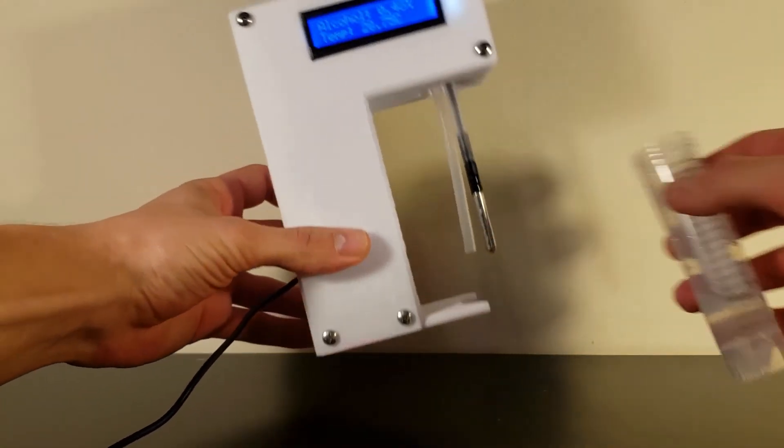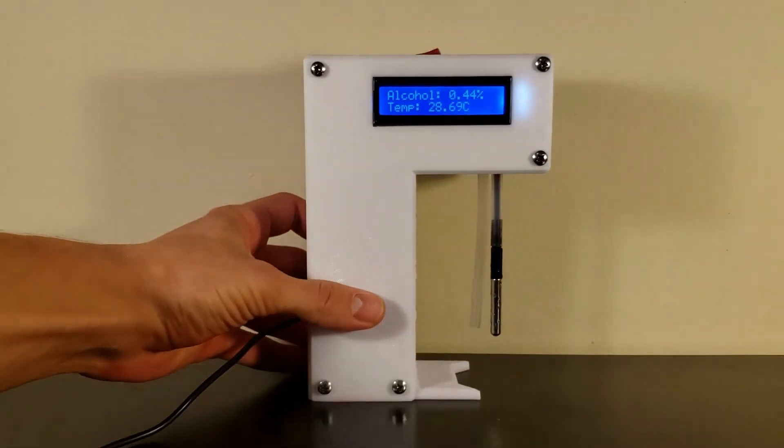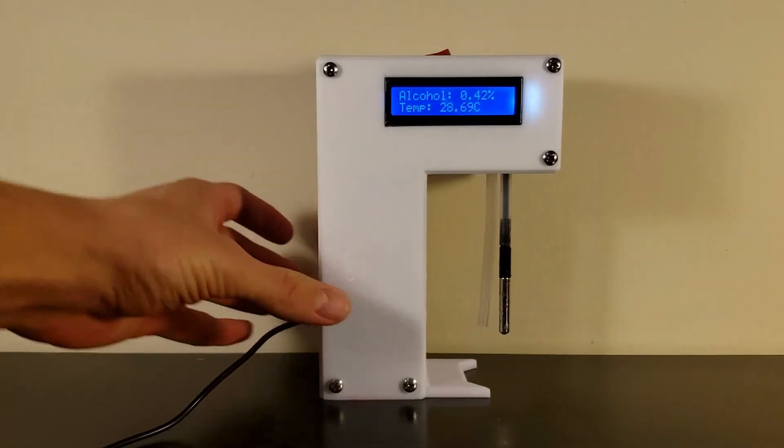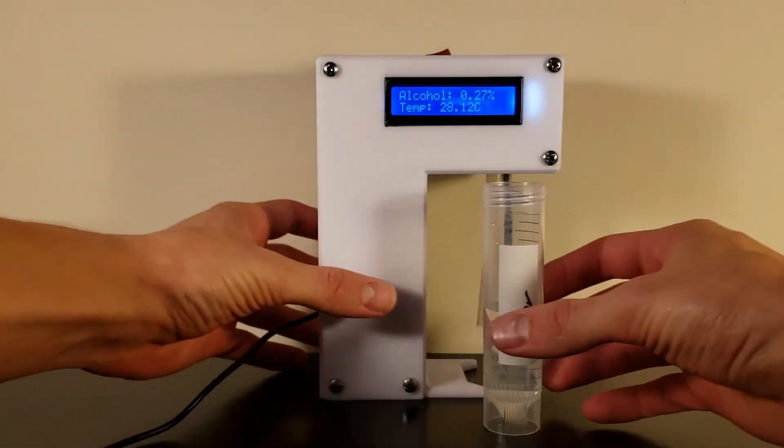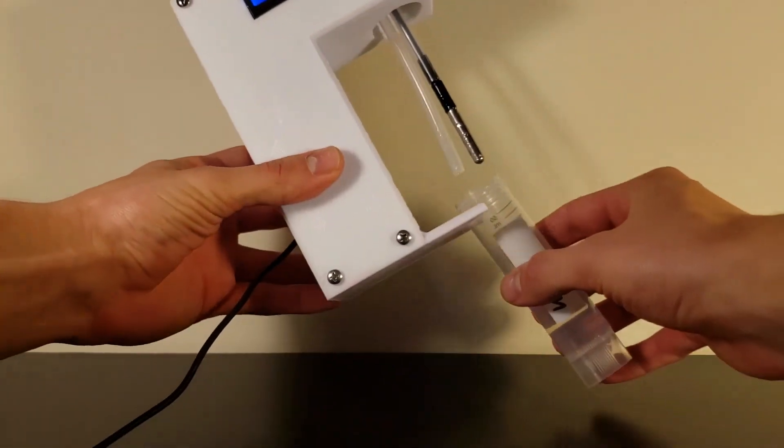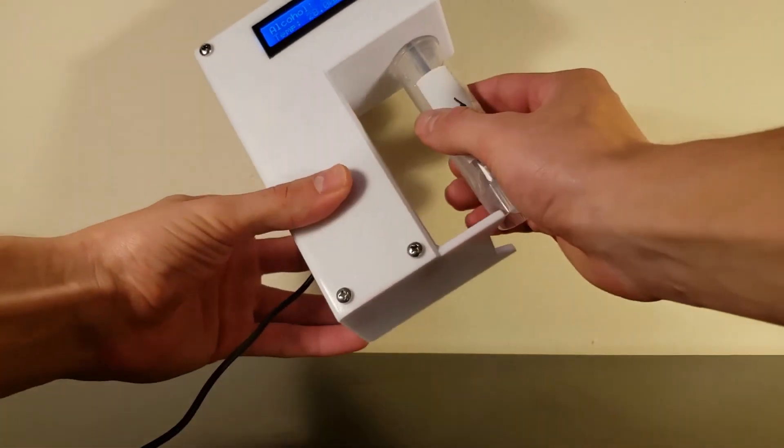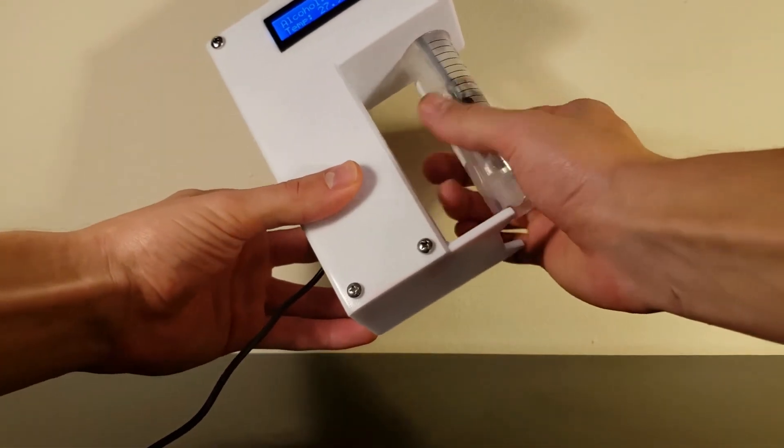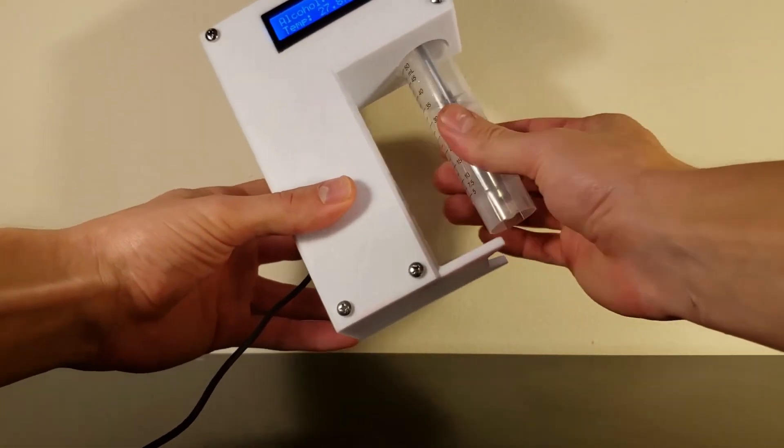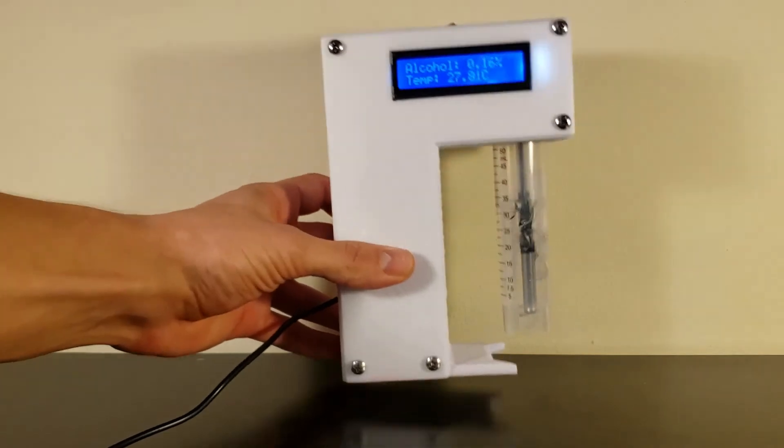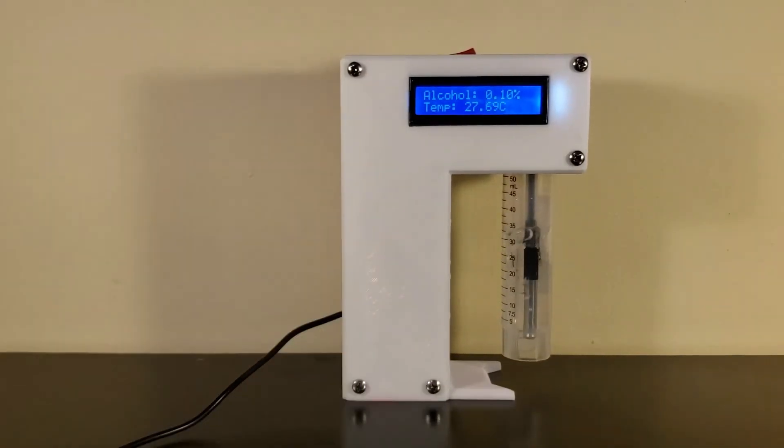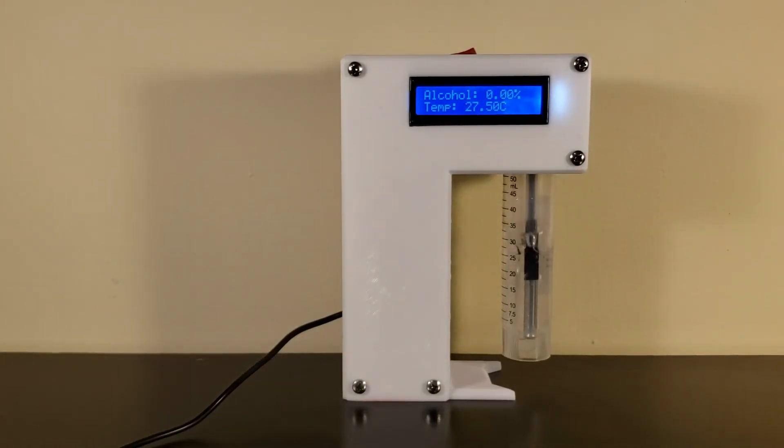After testing each sample, screw in a tube filled with 20 to 30 milliliters of water for about 30 seconds until the detector reads 0% again. Now you may repeat this procedure with as many samples as you would like.